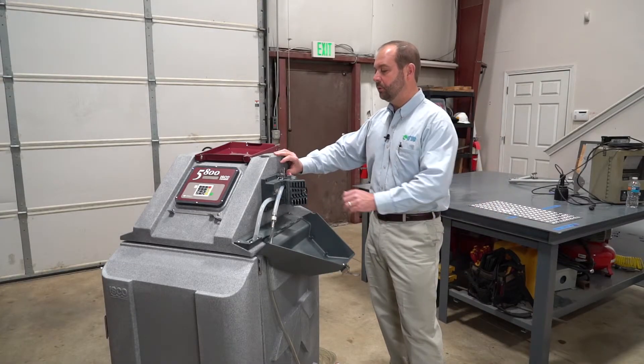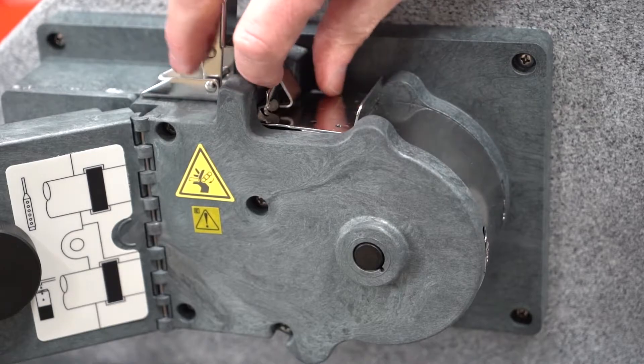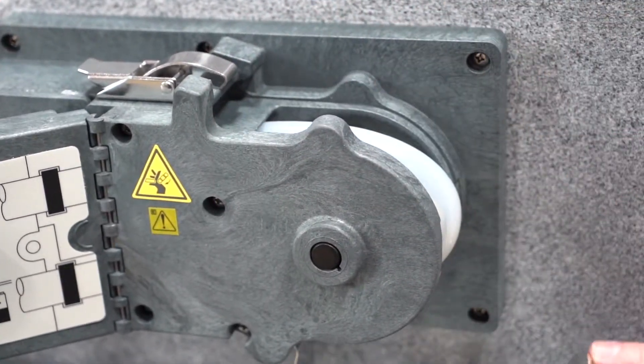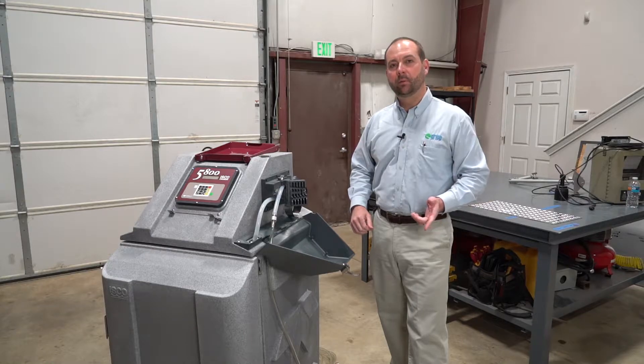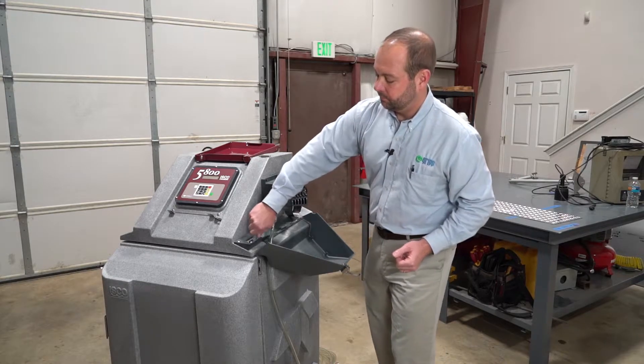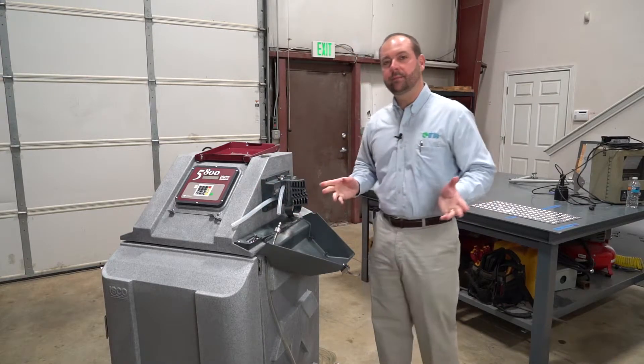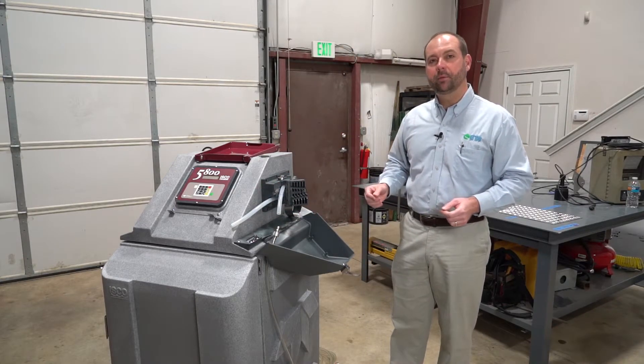Second, we want to open the pump housing band. Then we will want to disconnect the pump tubing from the bulkhead fitting and the tubing coupler. Once this is complete, the pump tube is now ready to be removed.